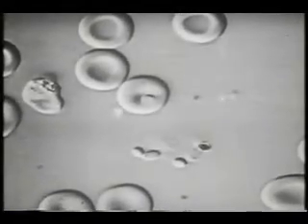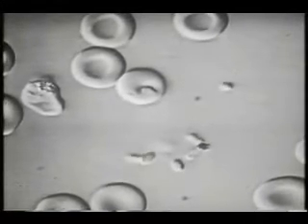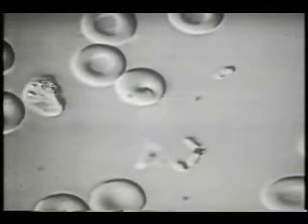This sequence shows two Merozoites attached to a dark refractal residual body forming the shape of a V. Note the structures at the end opposite to the residual body, which are probably the paired organelles.